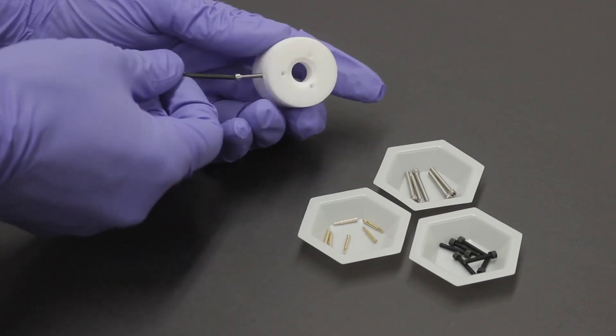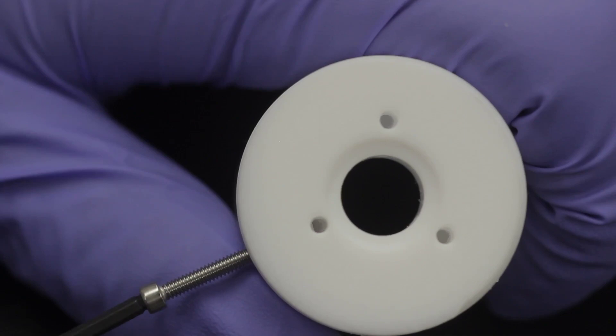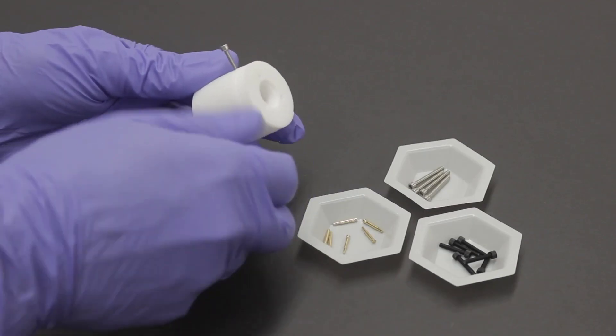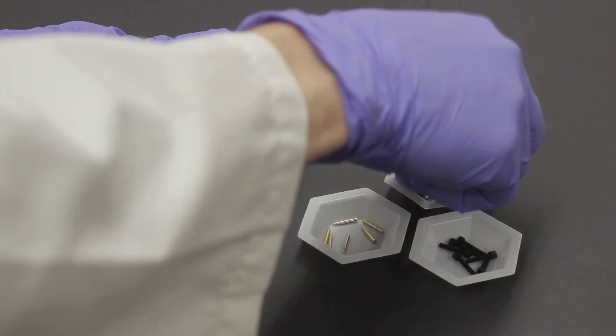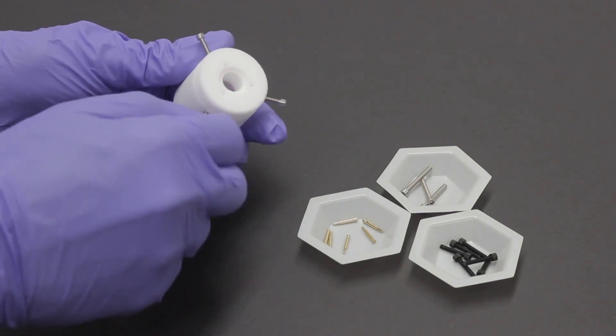If you have a bright light behind your head, you should be able to see the screw emerge through the pinhole in the bottom of the cell base. Install the other two contact screws in the remaining upper holes. The three pins provide some redundancy in case part of the working electrode delaminates during your experiment.